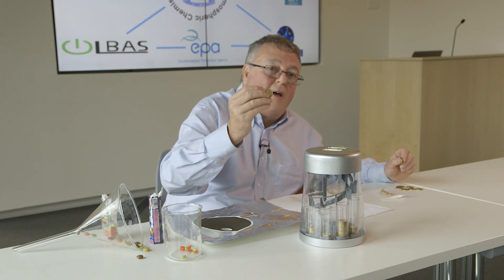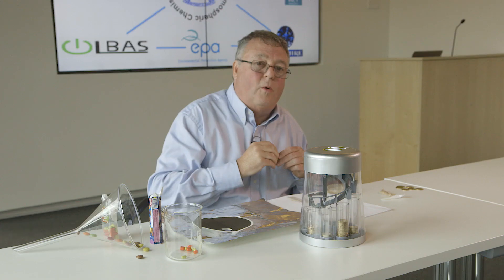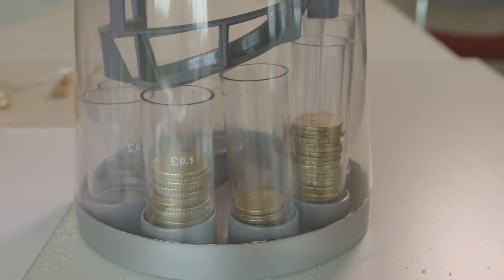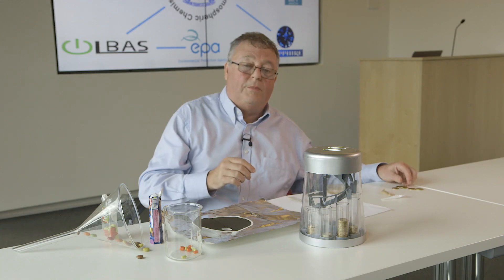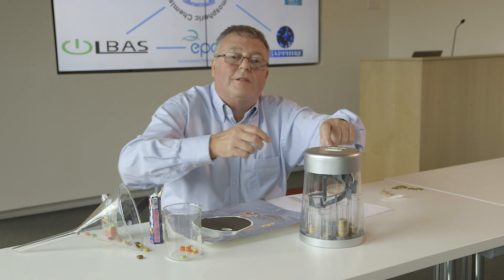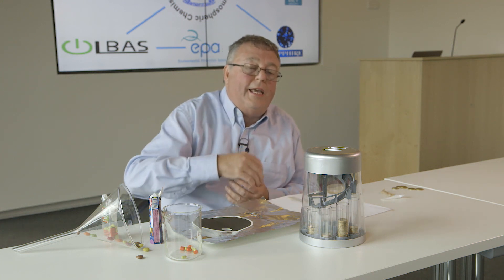The instrumentation is very sophisticated, but I can illustrate the principle with a crude old coin-box money sorter. Think of this as a particulate of one type — I put it in and it gets sorted into one bin; another goes into a second bin; a third into a different bin because it's a different particle. At the end, we count the number of particles of each type. We then do chemical analysis using a technique called ATOFMS and look at their mass spectra, and for biological particles — discriminating between pollen and spores — we look at their fluorescent spectra.